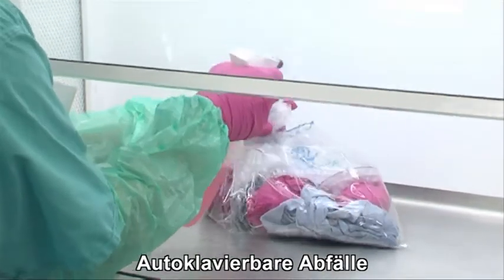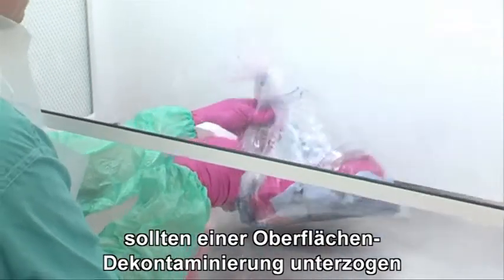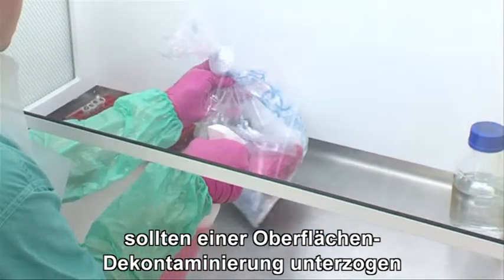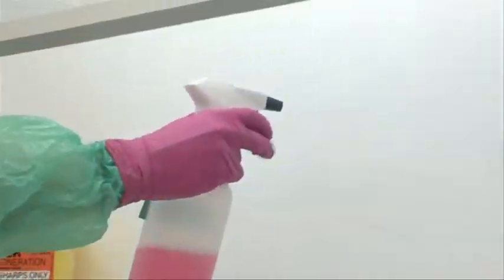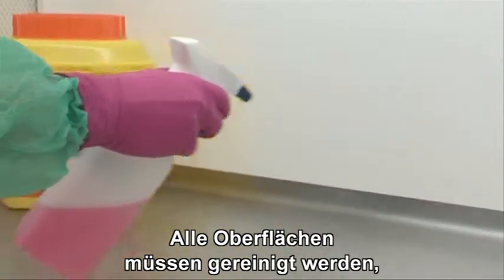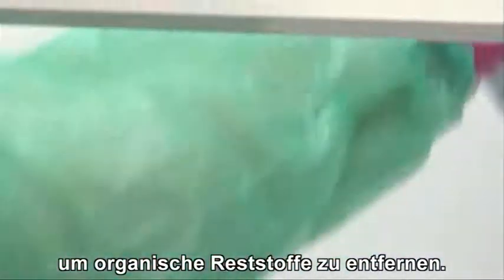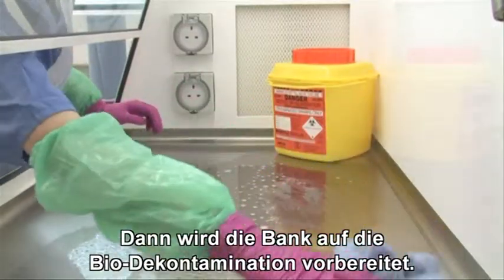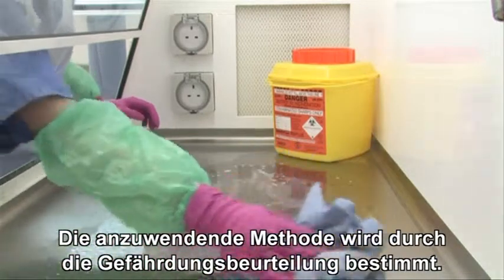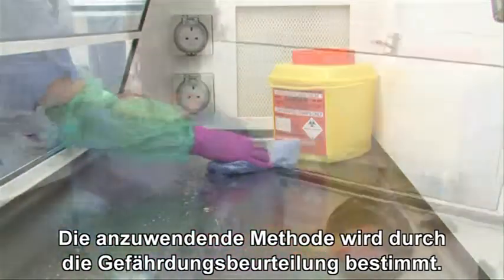Waste that can be autoclaved should be surface decontaminated and removed from the cabinet and discarded into the appropriate waste streams. All cabinet surfaces should be thoroughly cleaned to remove any residual organic matter. The cabinet can then be prepared for biodecontamination. The appropriate method should be determined by risk assessment.